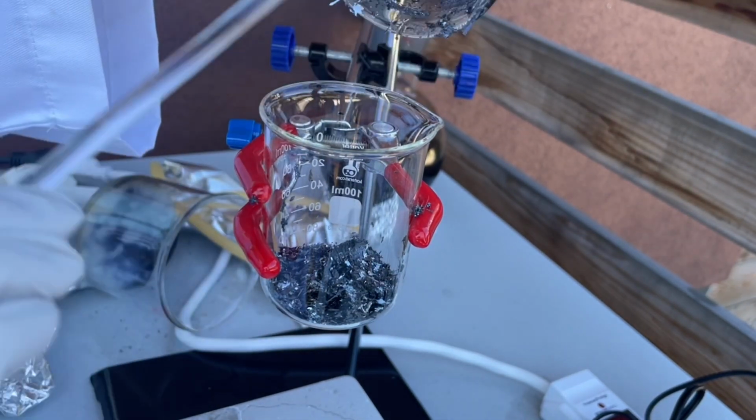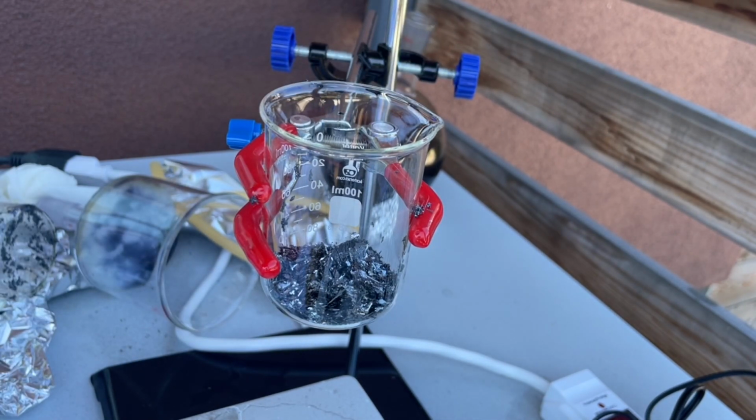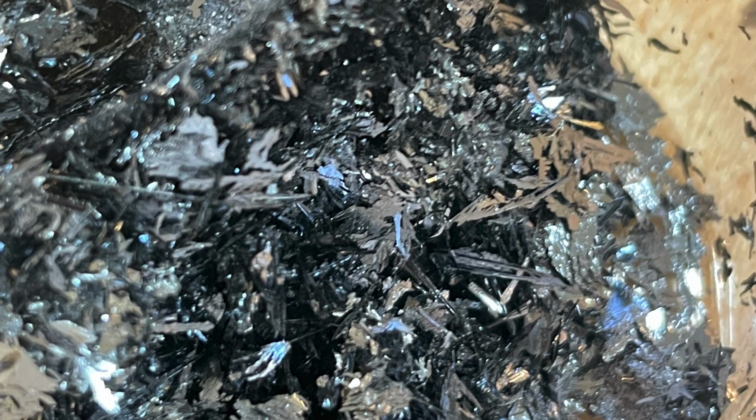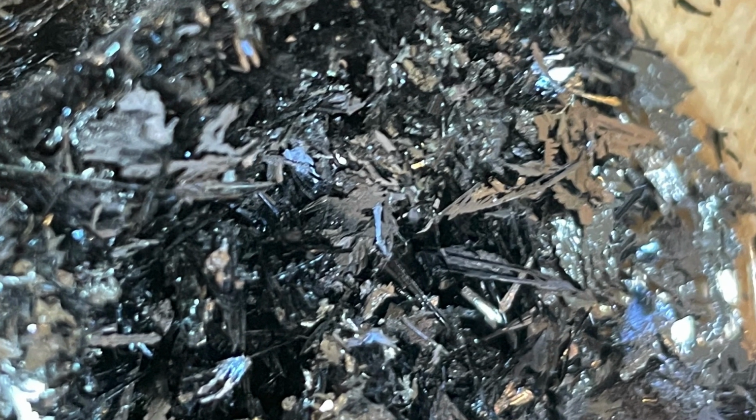I think there was still a lot of iodine dissolved in solution, and a bit was lost during the transferring steps. I suspect better yields can be achieved by using more concentrated reactants like 12% hydrogen peroxide or glacial acetic acid. Other acids could theoretically be used as well.